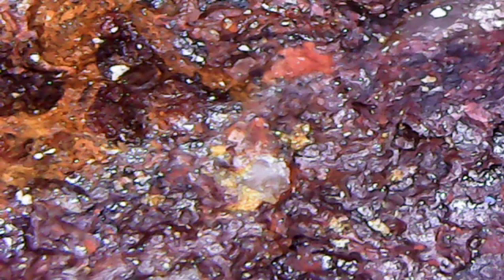Anyhow, here's the third sample. A couple of small pieces in there — I see maybe three, four, five pieces. Those big things that look like gold flakes are not. Here's another part of that sample, and this one has this big red line through it. I think that might be iron. We'll have to see how our sample fluids come out.